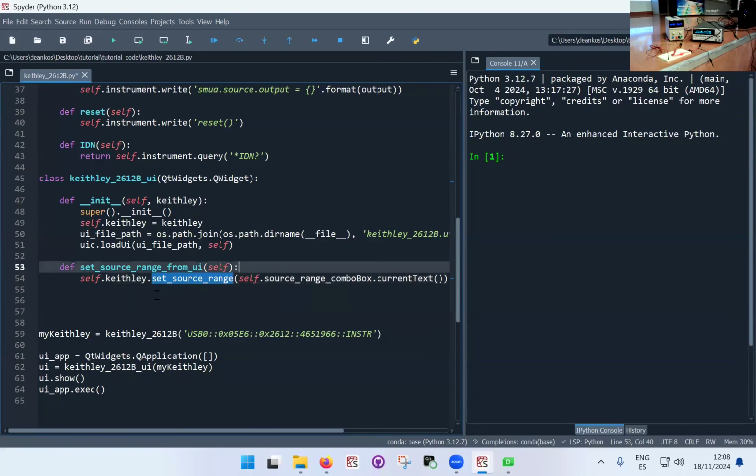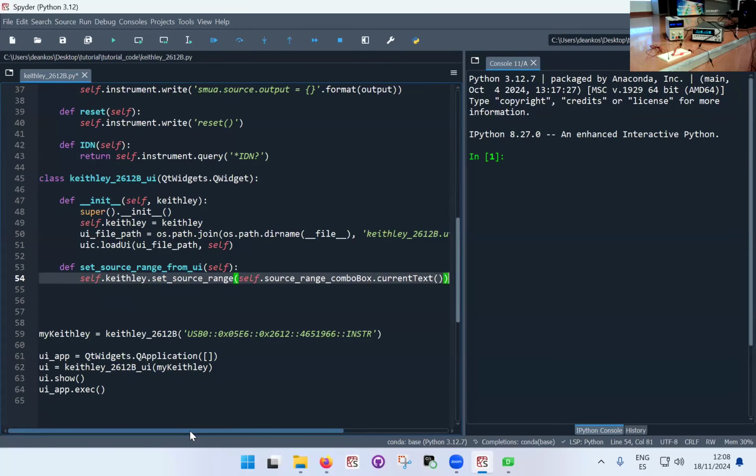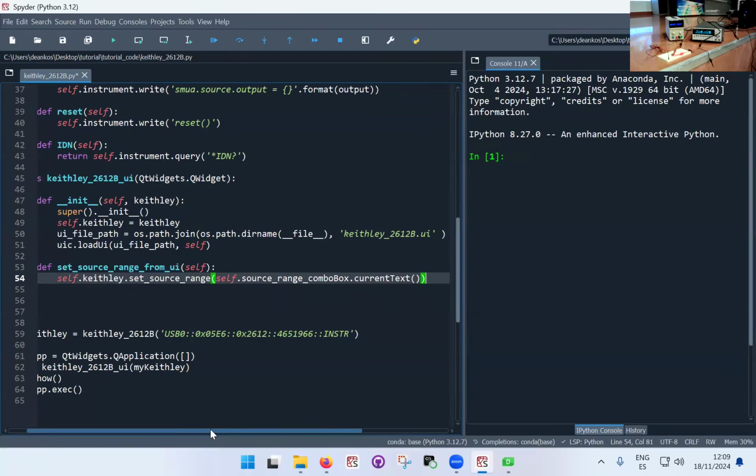This is sort of a more compact way to do it. I could put it in a separate variable and then call the function, but that's pretty much what you want, okay? You might have to transform to float. In this case, the Keithley is quite happy with what I'm going to give it. Actually, the Keithley will always be happy with text. The VISA protocol, in this case, takes care of this. With a serial instrument, you'll have to be very careful. In this case, the VISA instrument, if I pass a float, will convert it into text in an appropriate way, so the Keithley will actually take the value.